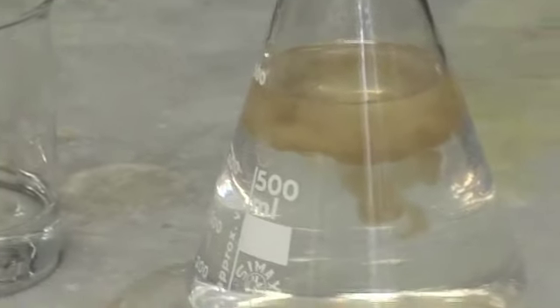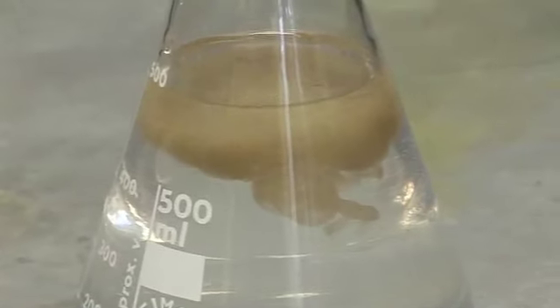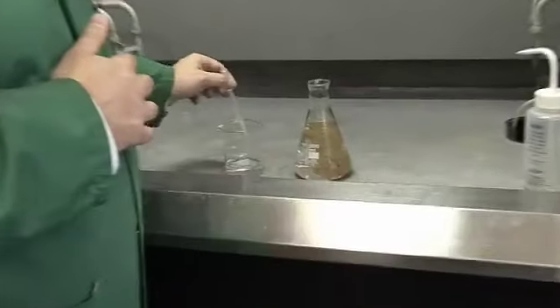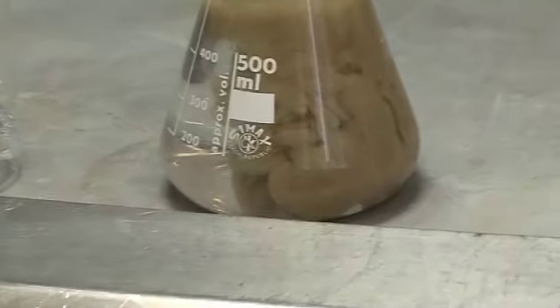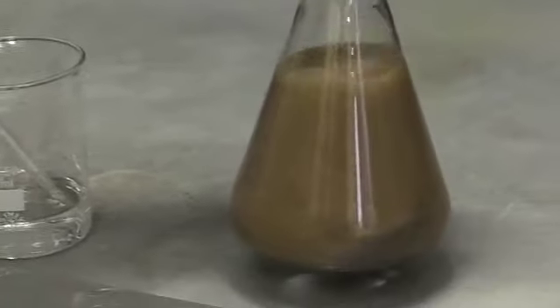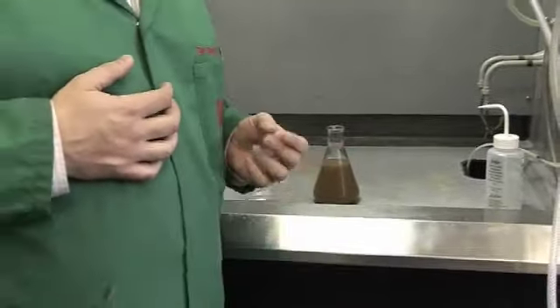It's the silver reacting with hydroxide within the aqueous ammonia solution that we're putting in, which makes this really nice brownish precipitate. So if we give that a bit of a mix, we can make that complete reaction. It's quite nice in itself and it's a really nice chemical reaction to watch, but it's not really what we need.